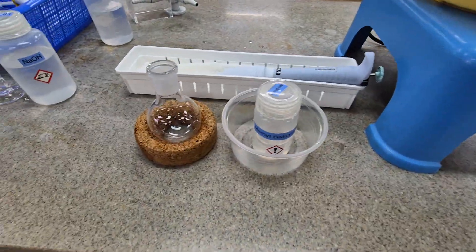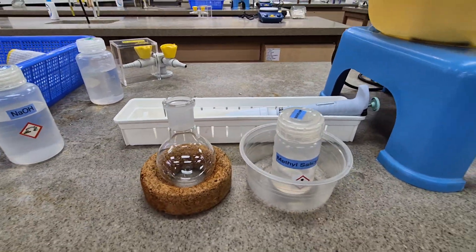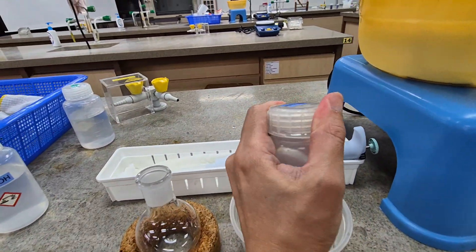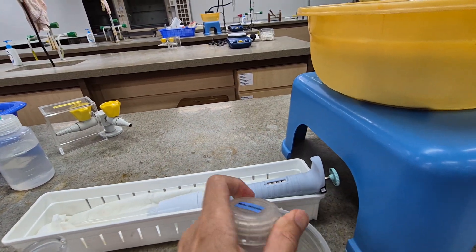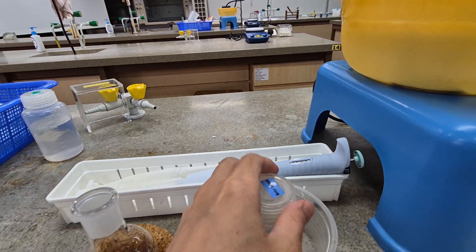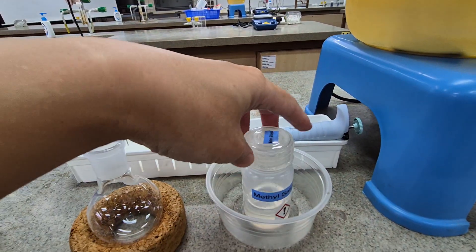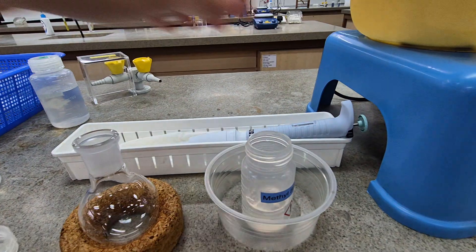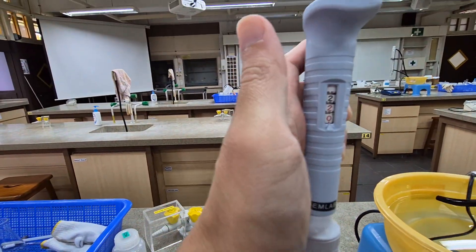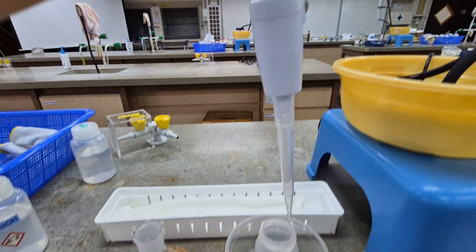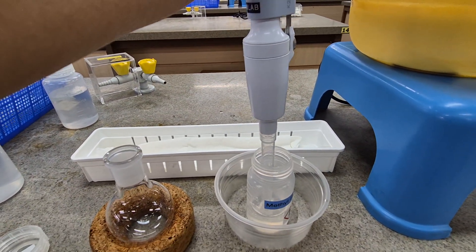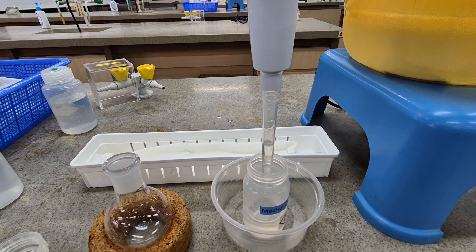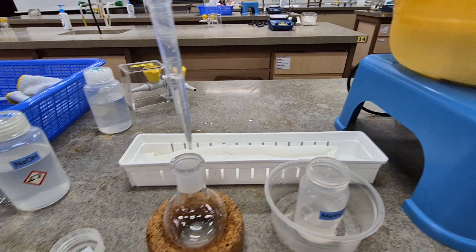We have the chemicals here. This is methyl salicylate. I'm going to uncap it first. When I uncap it, I'm going to introduce the required volume, which is 2.2 cubic centimeters. It has been adjusted accordingly. I'm just going to introduce the volume in.